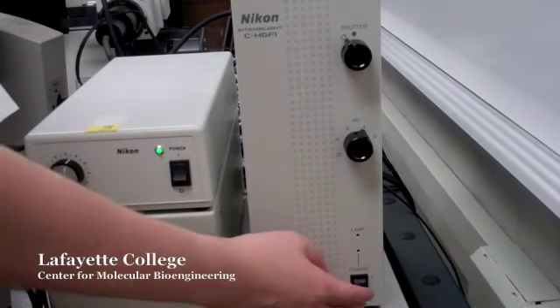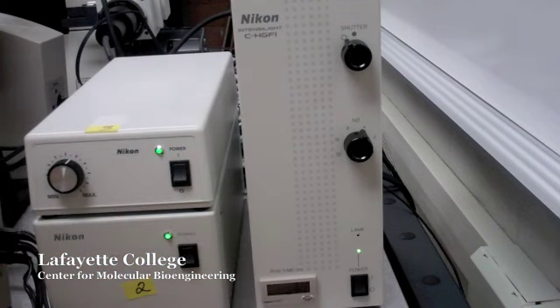Switch the power supply for the mercury light labeled Intensilite to the on position.